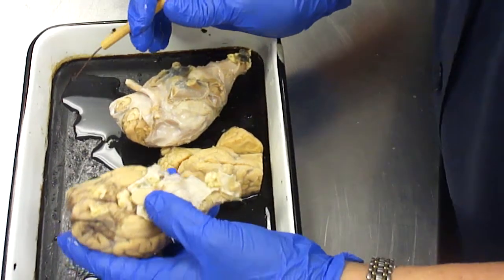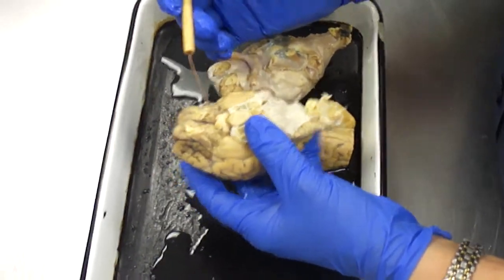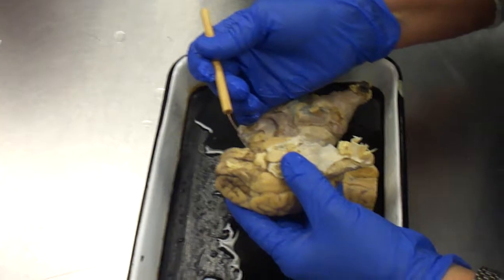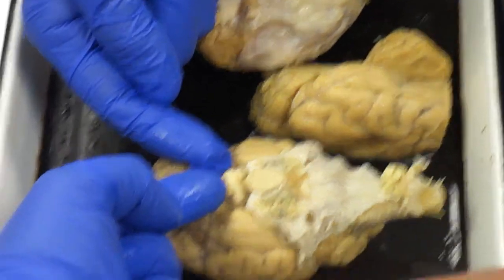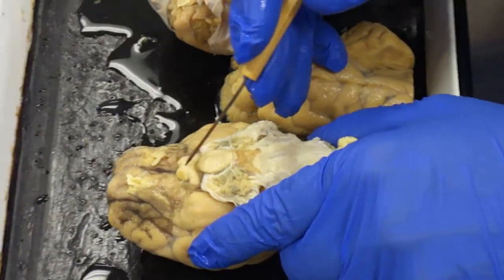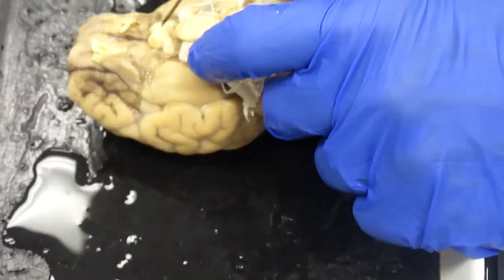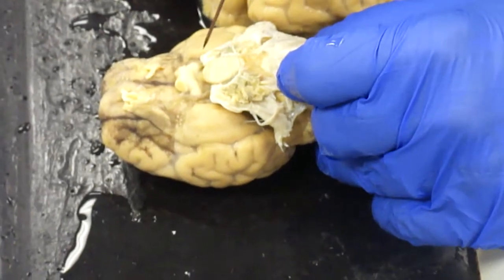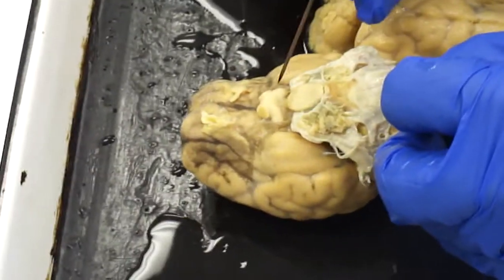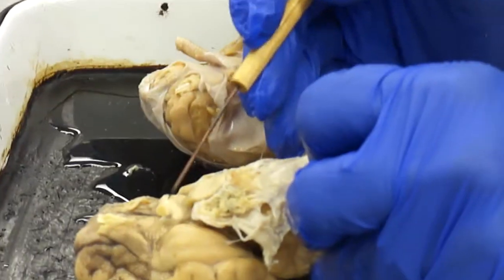Now, the optic nerve and the optic tract and the chiasma. So the optic nerve, you can just see a little bit of it there. The optic nerves come from the eyes, then they cross at the optic chiasma and continue as the optic tract. A tract is a bundle of neurons inside the CNS, and we'll say this on Monday in class. So the optic tract, the optic nerve, and the optic chiasma.